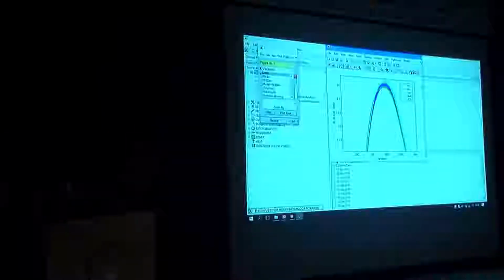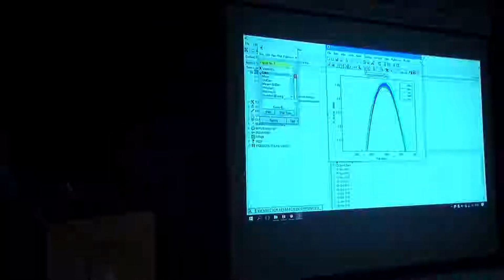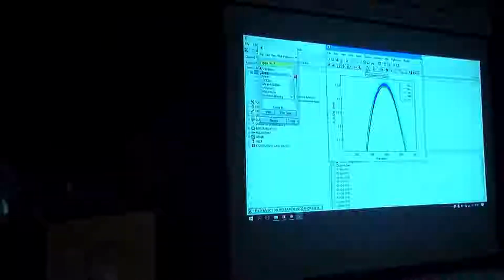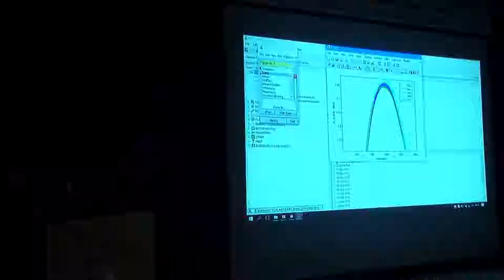So you can see we've got water, acetate, lactate, sodium chloride, and potassium chloride. You can see some spectral shifts there because of the temperatures. An important feature of this data set is that you've got a lot of replicates. Same samples are replicated under different conditions, different days, different temperatures. And we want to use those replicates to basically remove the interferences. I think historically you subtract to get rid of those, but I want to show you a different approach.